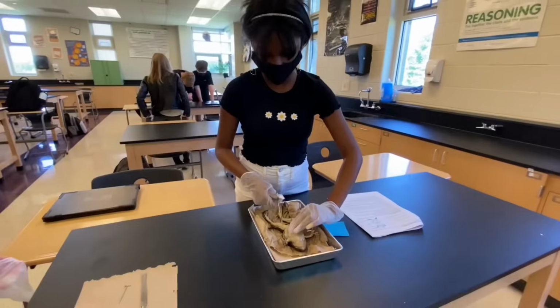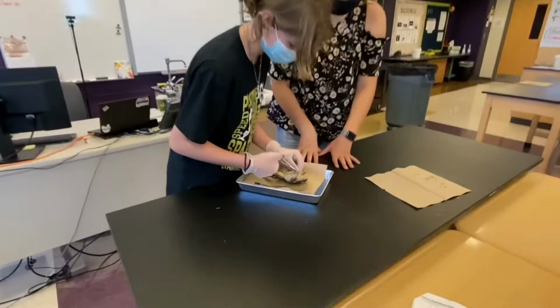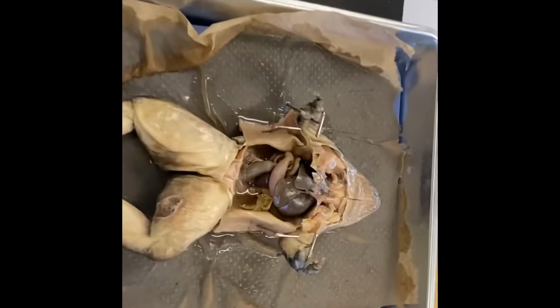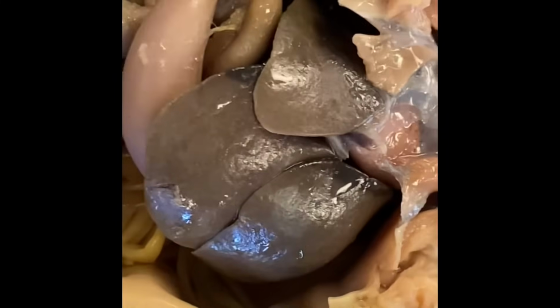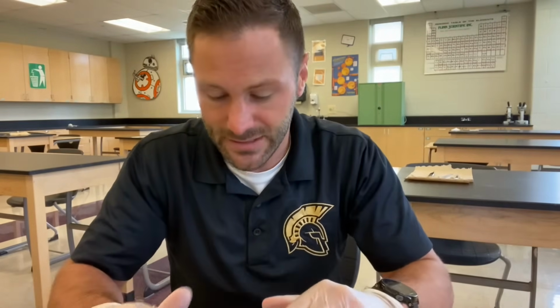Now when you open the frog and dissect the frog, the coolest thing that you see right off the bat is the liver. The liver is an organ that helps digest and break down the food. The liver, the gallbladder, the pancreas, all of these glands help digest the organism as it moves through the frog. So it can send that energy to the cells that it needs as it breaks the food down.